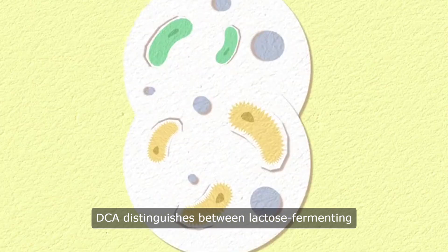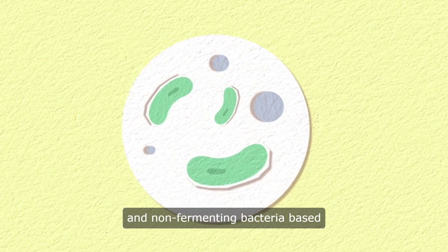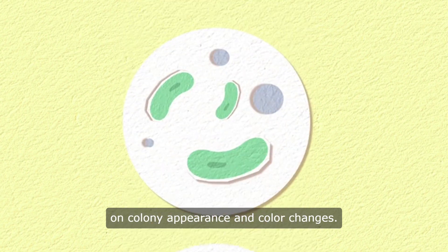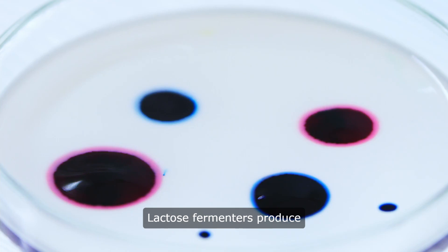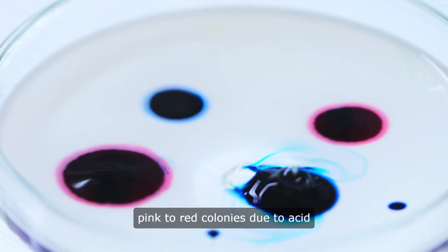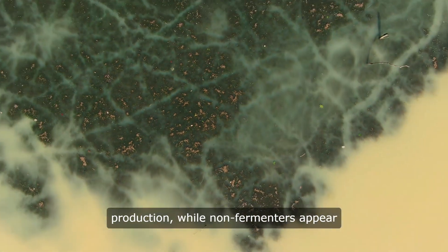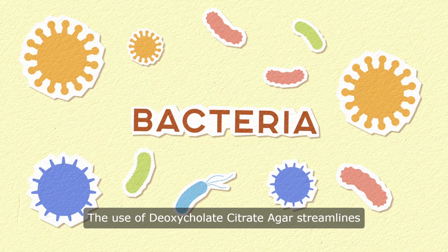DCA distinguishes between lactose-fermenting and non-fermenting bacteria based on colony appearance and color changes. Lactose fermenters produce pink to red colonies due to acid production, while non-fermenters appear as transparent or colorless colonies.